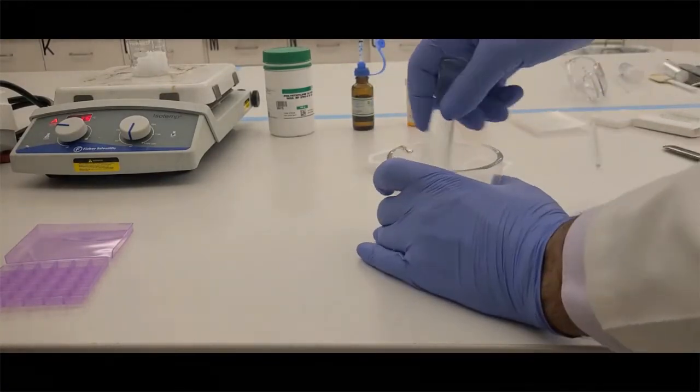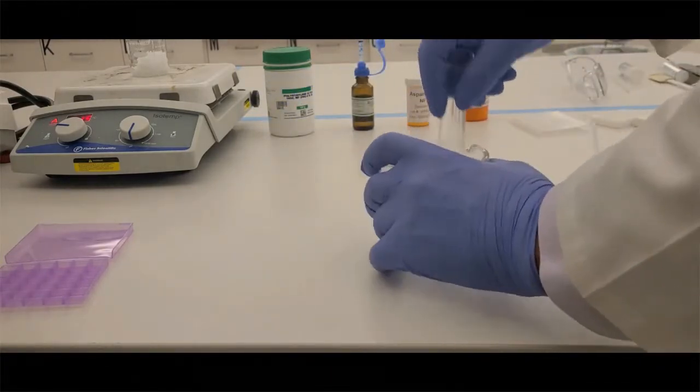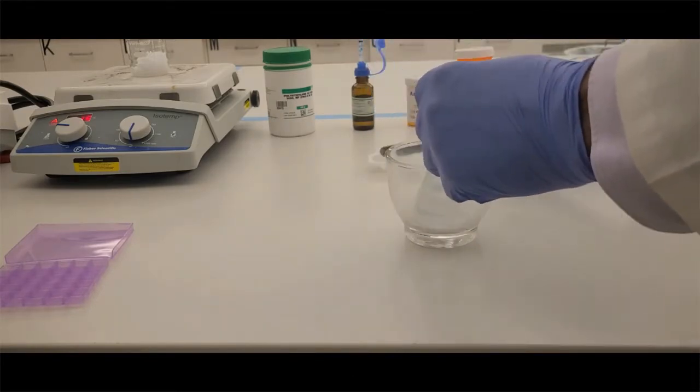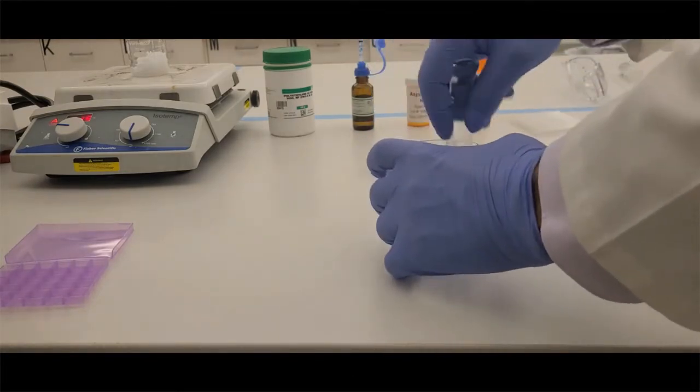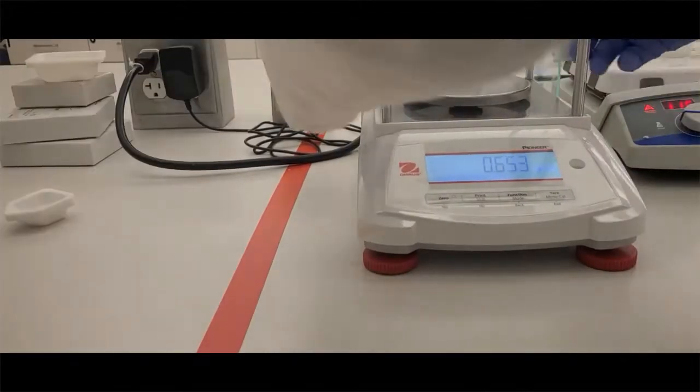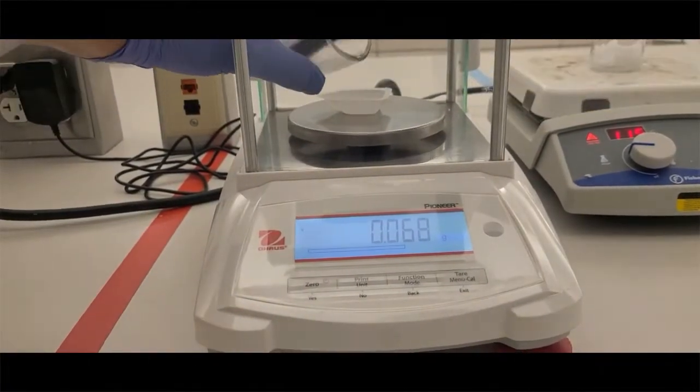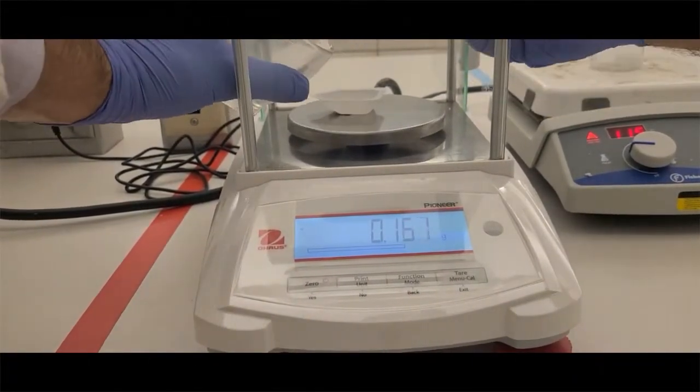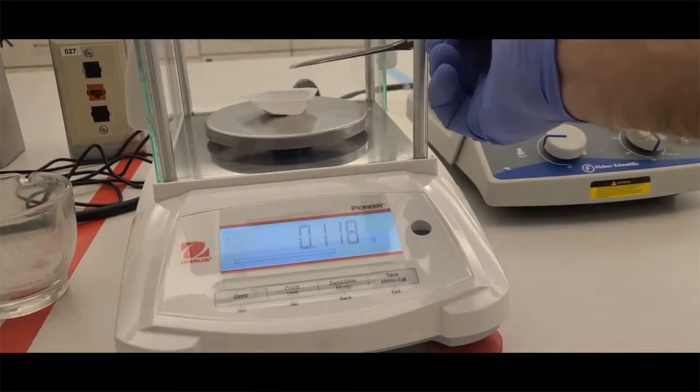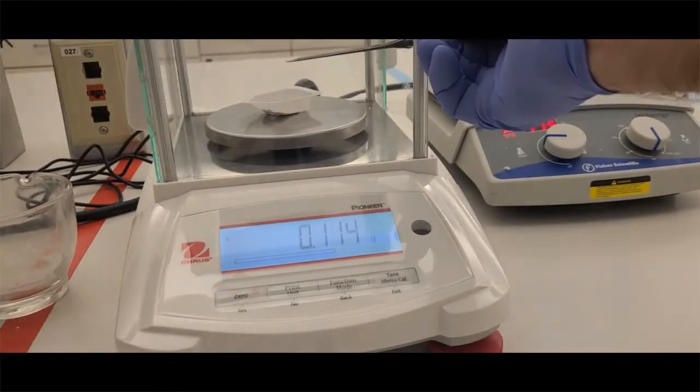Next, I'm going to make our aliquot for our drug and aspartame. So in this case, both of these are required ingredients. You usually put the aspartame in first, coat it, and then add an equal amount of drug and do it geometrically if needed for the different amounts. But ultimately, we have a large amount of an aliquot we need, and we're going to take away from that aliquot the amount that will contain our drug and our aspartame. So looking at our formulation, that's what we calculated out for.